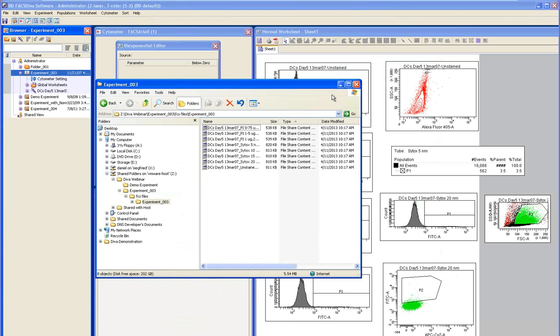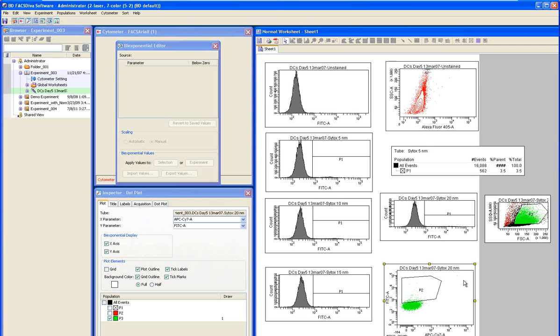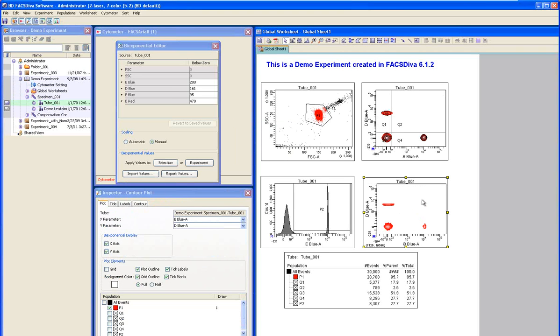So when I come back into Diva, I can minimize the Windows Explorer window and just pick one of these plots, the bi-exponential editor. Maybe I need to come back to the demo experiment. Okay, so when I'm looking at tube 1 in the demo experiment inside Diva, I can see many of the bi-exponential settings here. This parameter has a setting of 200, D blue is 161, and so on. It's called the below 0 parameter. Below 0 just roughly means how negative the values get. And then that number gets fed into a formula that tells Diva how to display the rest of the data.